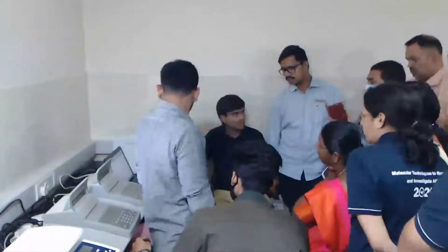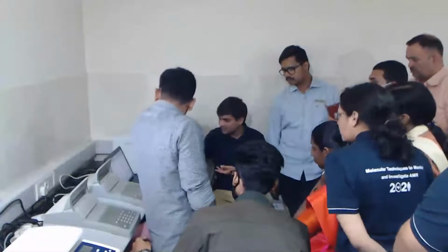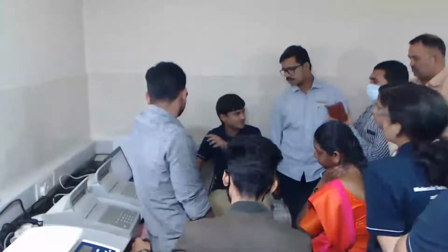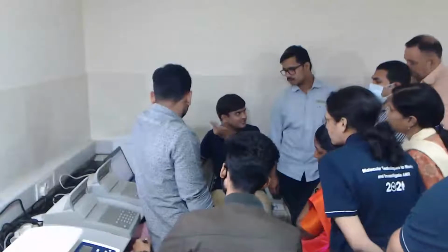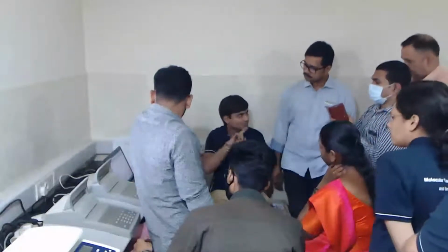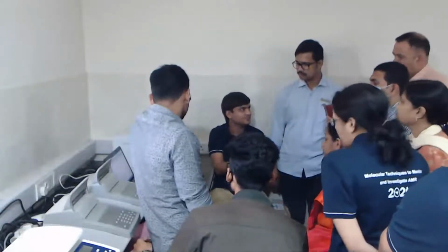Bottom is timeline, but since we have ladder with us and we know all of them, we can convert it into base pair. Time can be converted into base pair based on the ladder information. And since markers are also added in all the samples, we know the relative position of 15 and 1500. So therefore, over there also using that information, they can be converted into base pair.